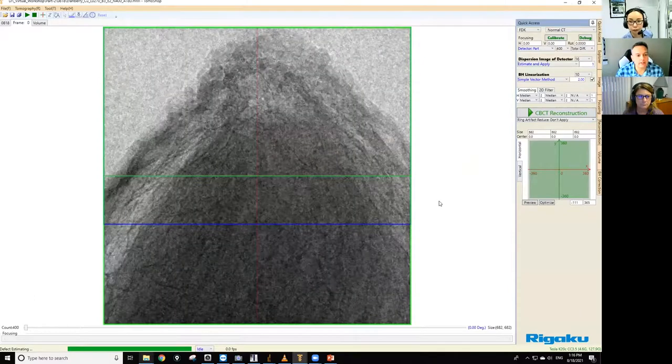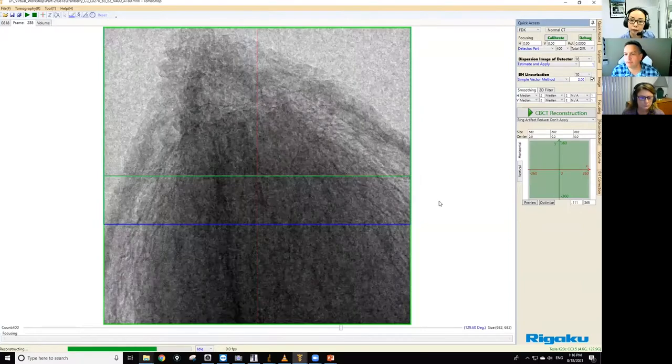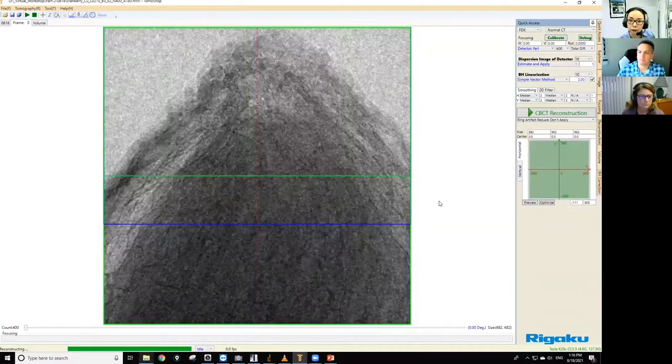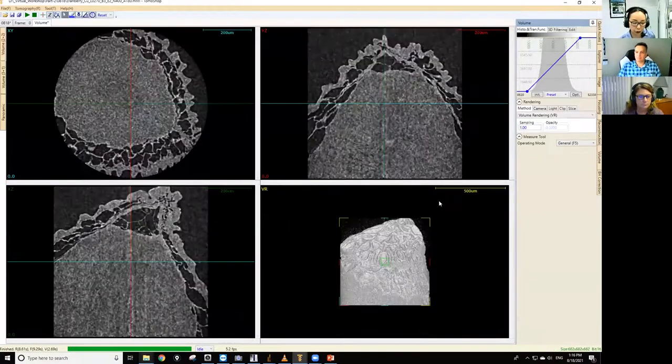So Aya, Mao has asked, I hope I'm pronouncing that correctly, can you just review the settings for that scan again? That was a copper source. It's a copper source. That means you have a mostly 8 keV X-ray energy. And we have a 20x lens, and we're using binning 3x3. So that means your voxel size is 0.965. That's your voxel resolution. And we collected 400 projections in 2 minutes.